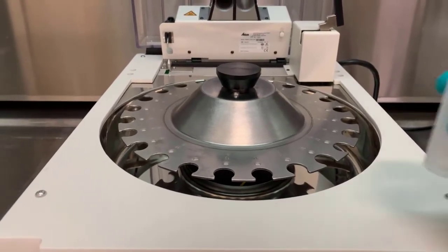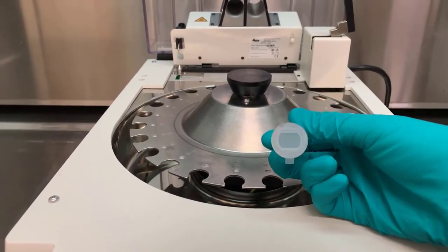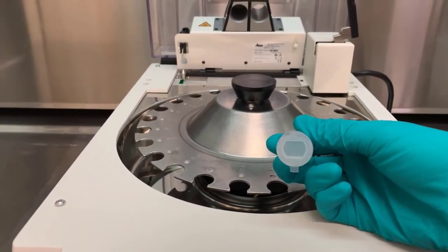To describe the hardware of the EMTP, I'll begin with the reagent vials. These vials have a specialized base.